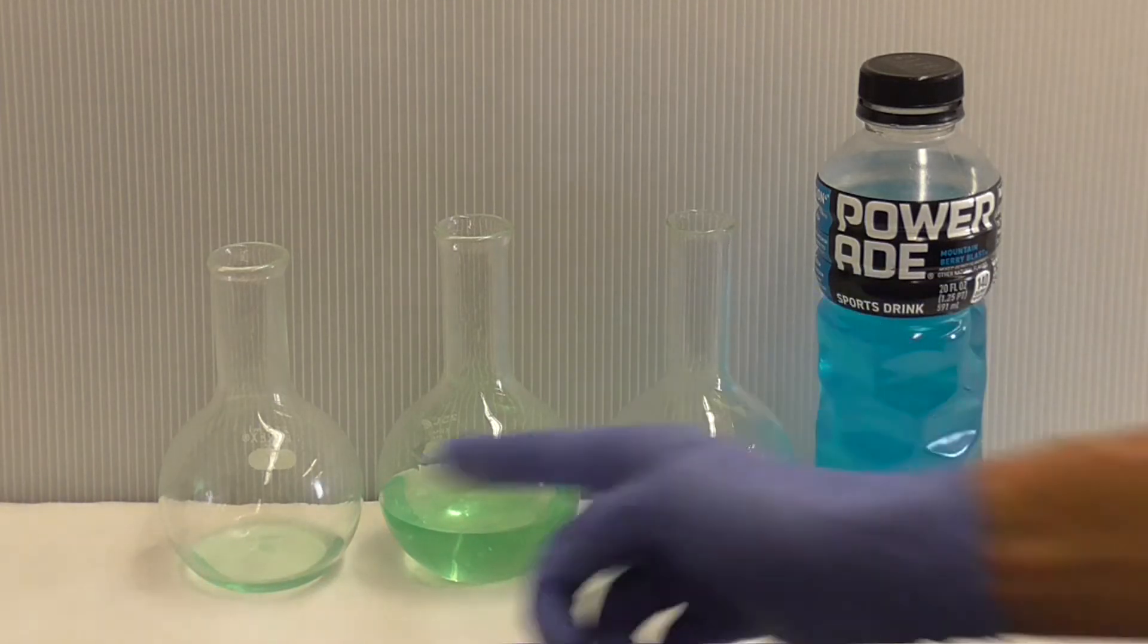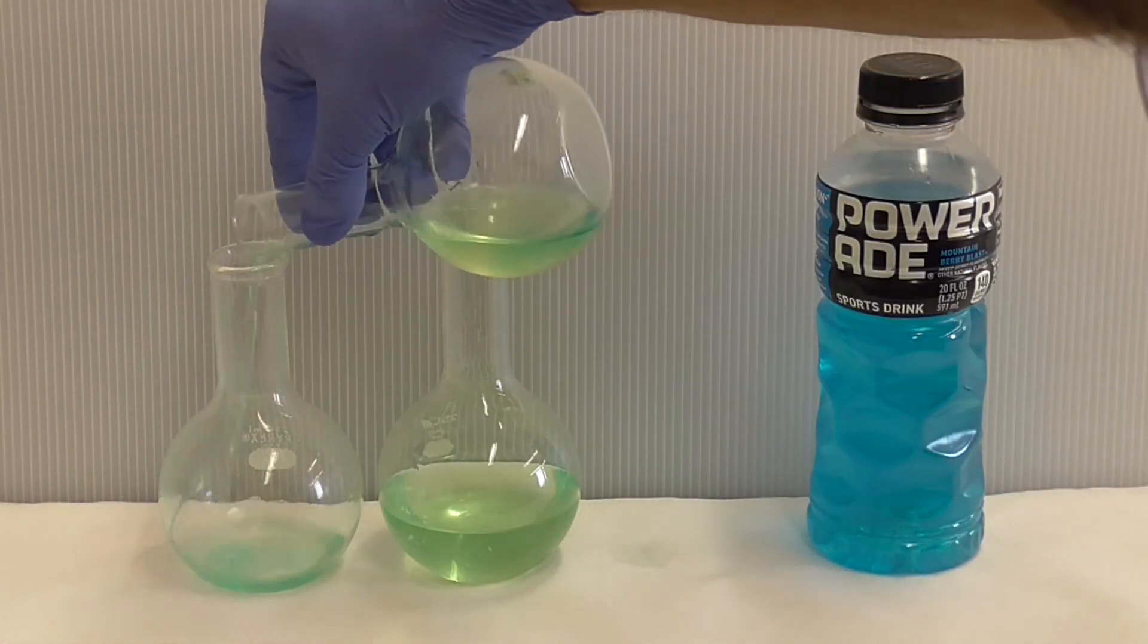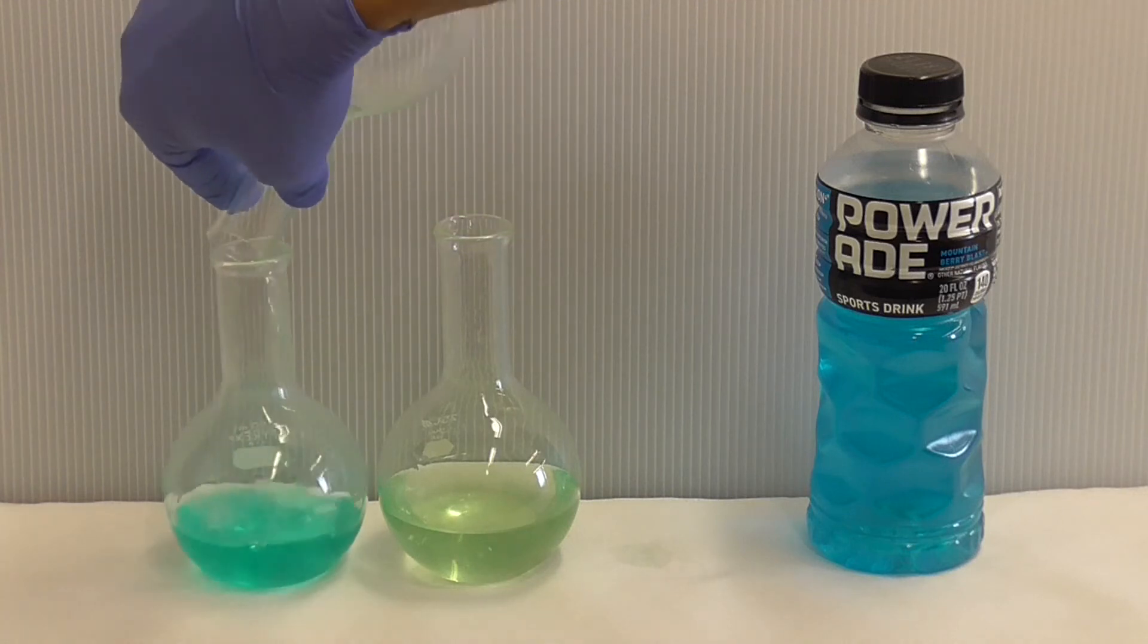Interesting. Let's pour this one over here and see what happens. Sure enough, there's that blue color!